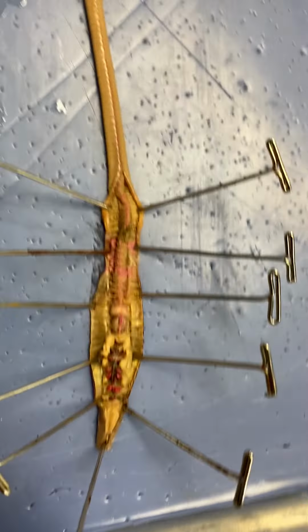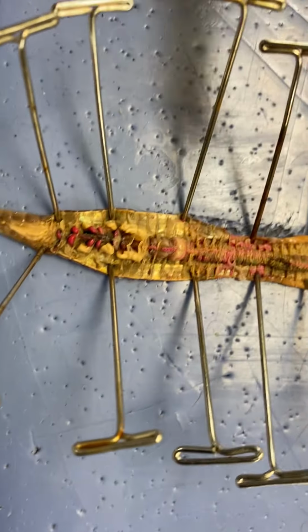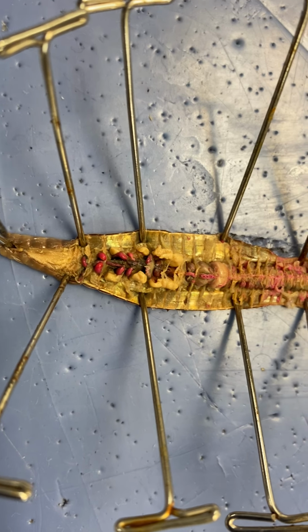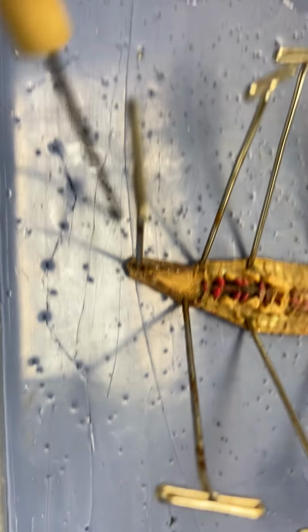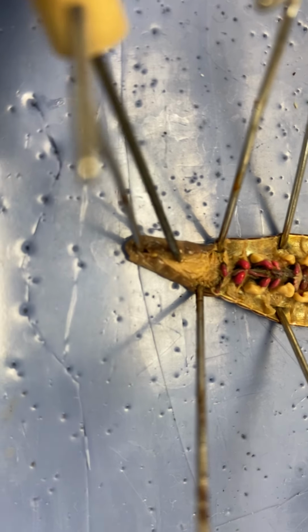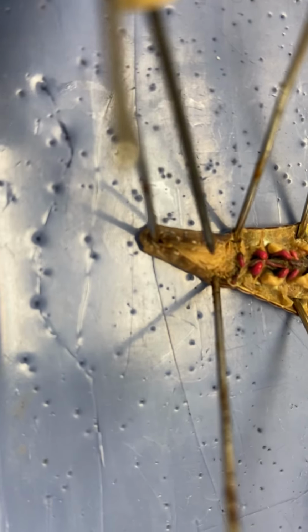So, here, let me put it sideways. So I'm going to go over the structures. So here we have the mouth. There's an opening right there. We have the prostomium and the mouth. This muscular structure right here, that is the pharynx. So it goes mouth, and then the pharynx.